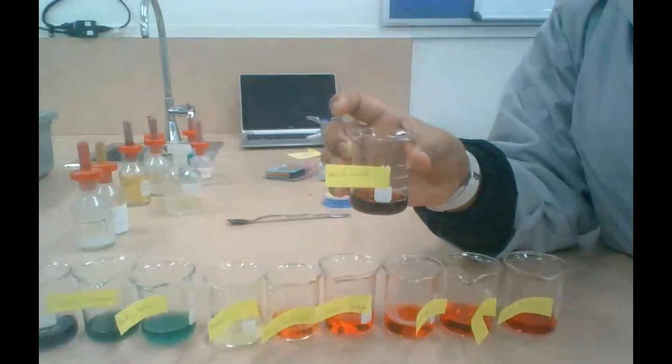Finally, this liquid is a brownish red, meaning that it is the most acidic.